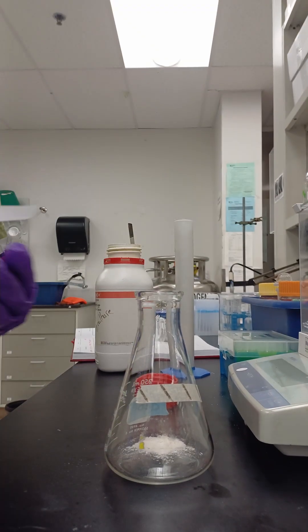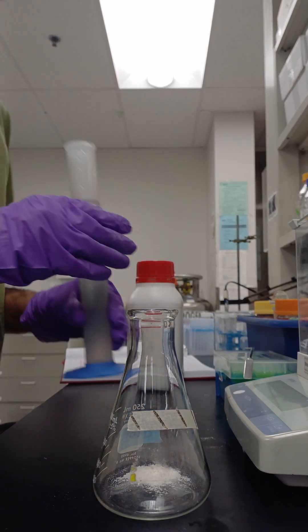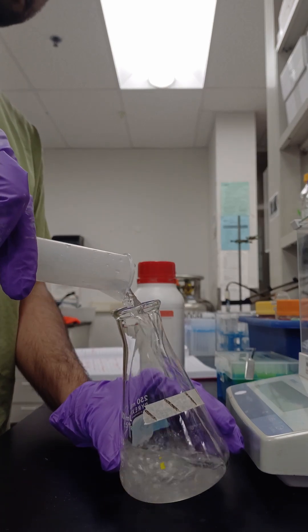We use Middlebrook 7H9 broth for this, but unlike media like LB, we don't fill it entirely with distilled water at this time.